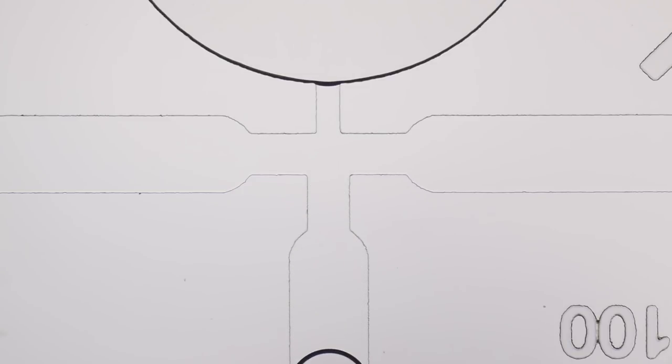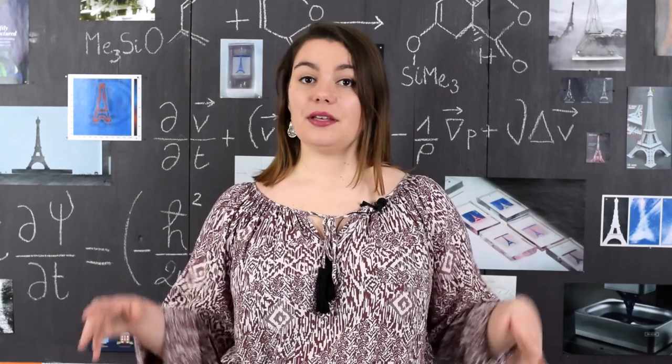Below, the channel where the water will flow. And above, the large chamber where we'll collect the droplets. Now that the oil has been taken care of, we just need to bring in the water.